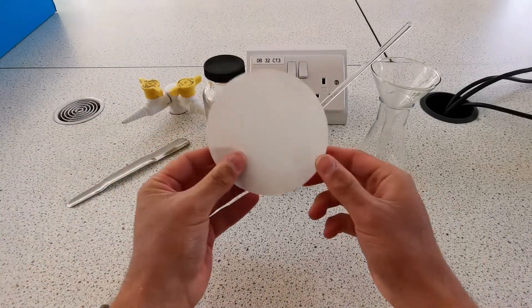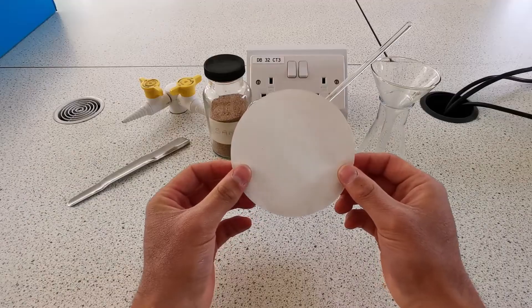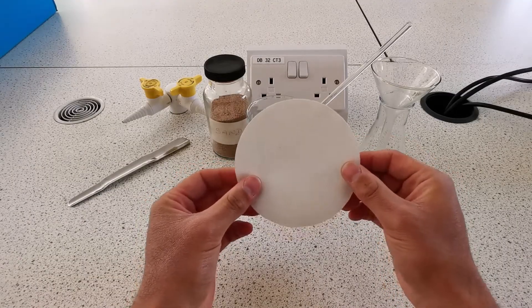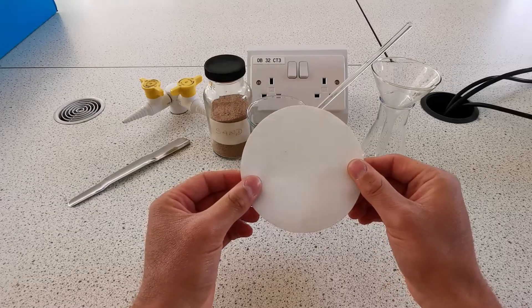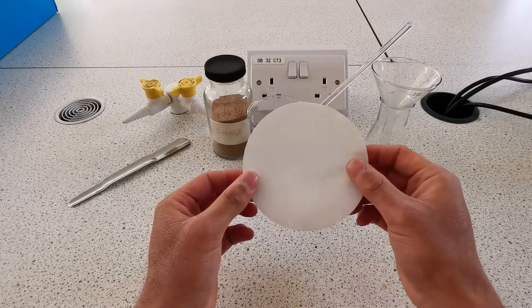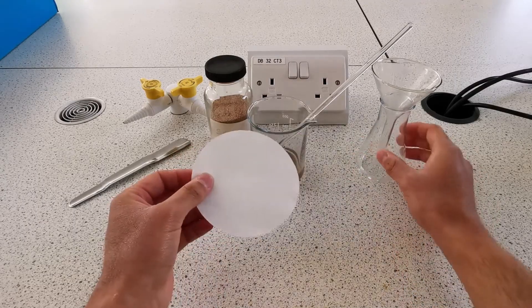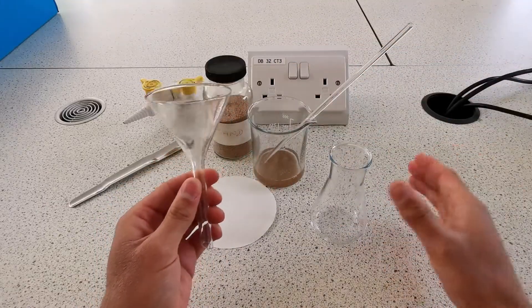The filter paper has tiny holes in it that allow small particles to pass through, such as solvents and the solutes dissolved into the solvents. Particles of insoluble solids are too big to fit through the holes, so they do not pass through. So the sand particles are too big.